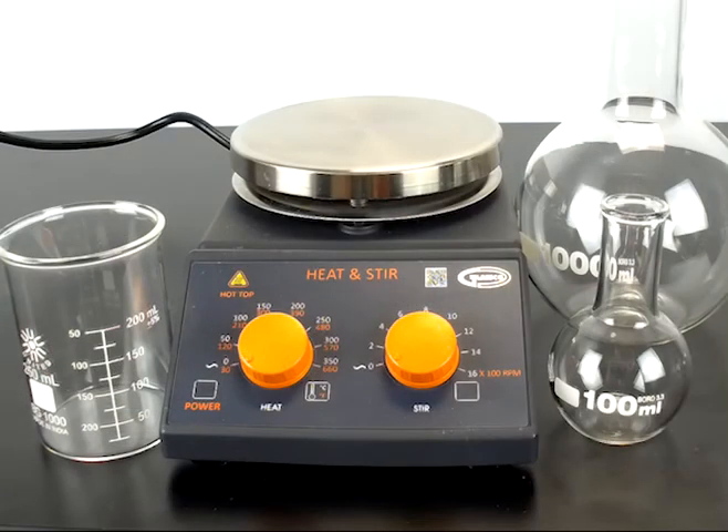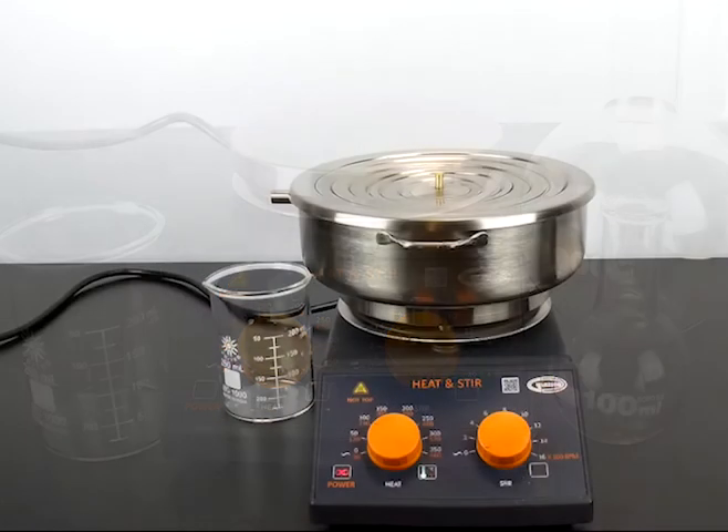The only other materials that you require are a hot plate, whatever flask you're going to be using to maintain a constant temperature for, and just a small beaker or something to catch any steam that might come out the nozzle. So here is our general setup.